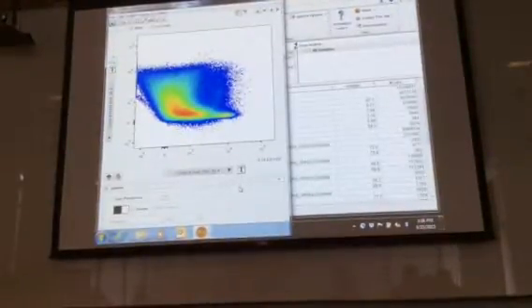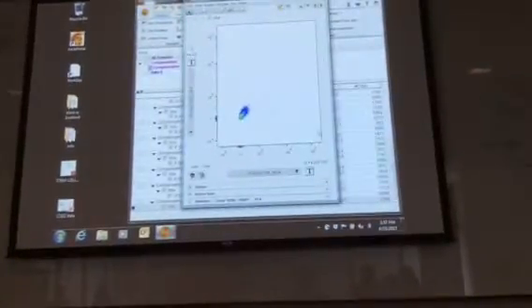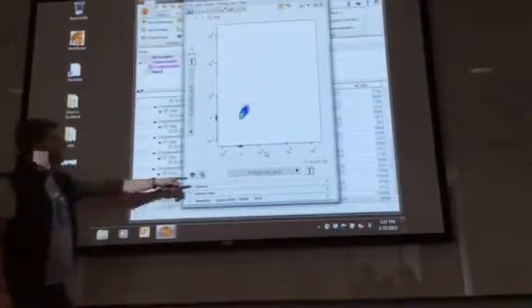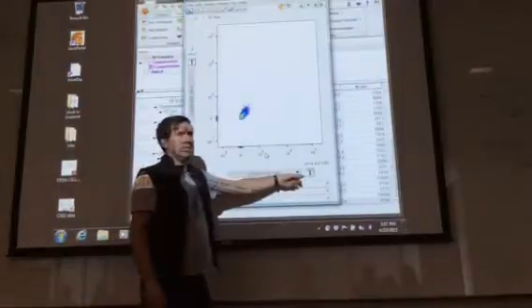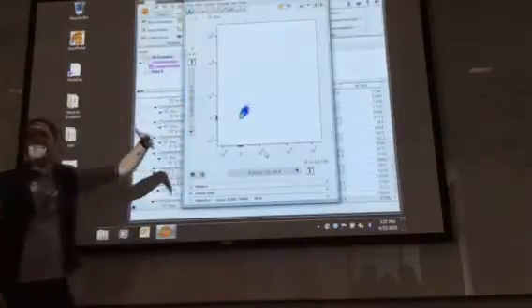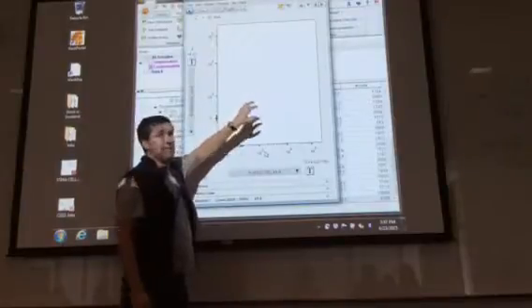Could you talk through using the unstained controls to pick the gates again? Yeah, I mean, so if you have the unstained controls here, and you were going to look at whichever dye combination, what you typically have to do is make sure that on the x-axis and then on the y-axis is the particular combination of dyes that you're looking at. When you do that, you'll look to see where this population of cells sits.